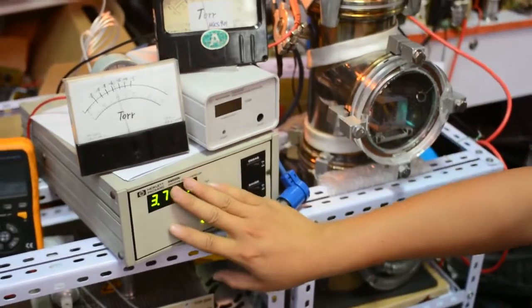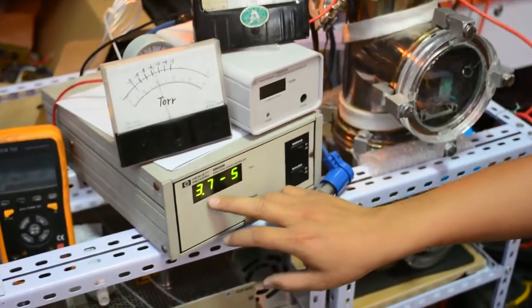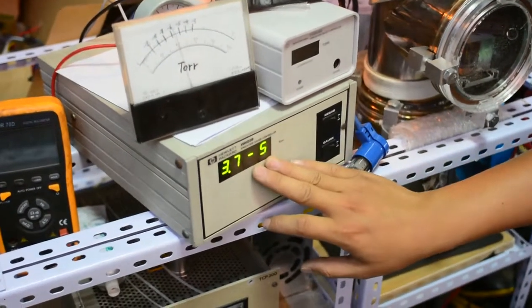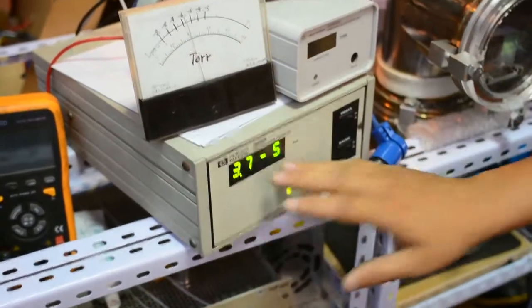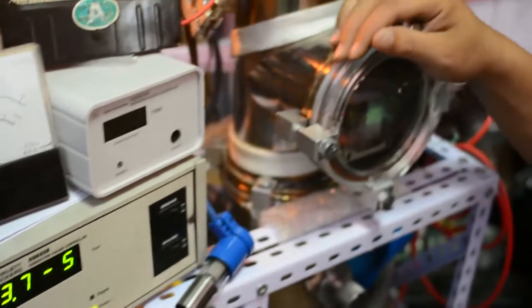After about 20 minutes pumping, it is dropping down to this vacuum level. I have to say it is a very good vacuum level for the scanning electron microscope operation.